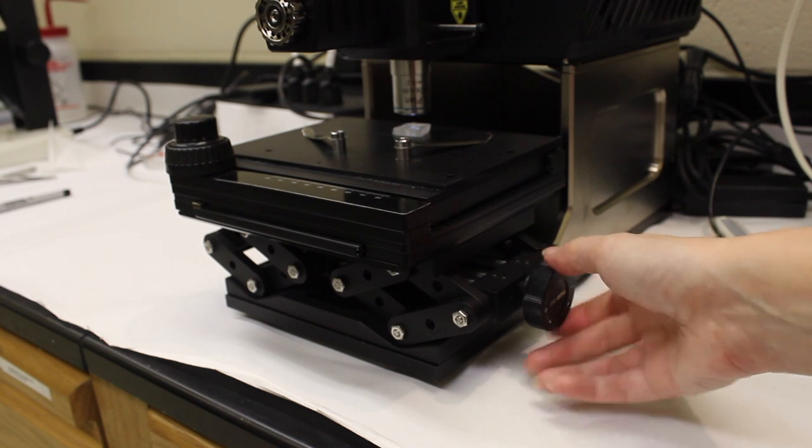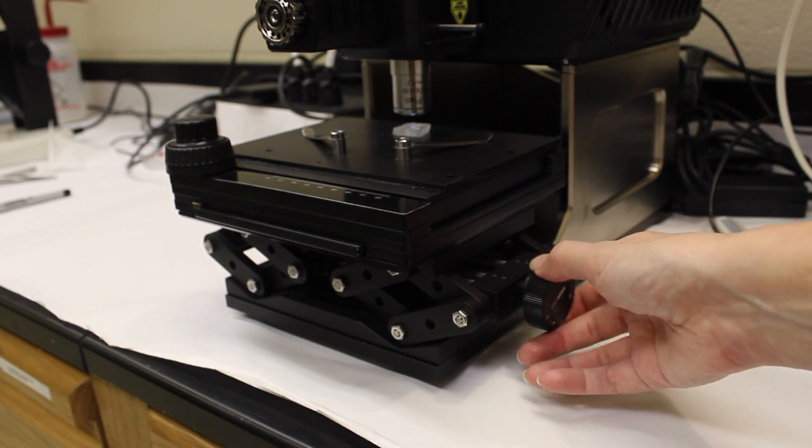You should be able to see the LED light on your sample and also use that to help you focus.